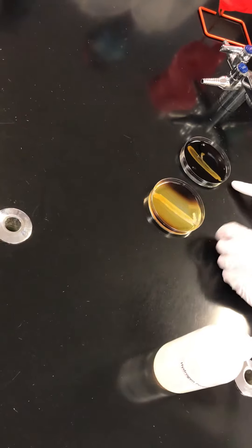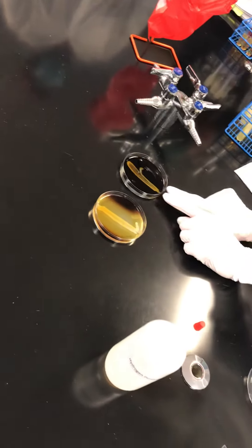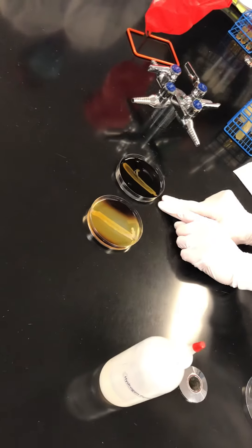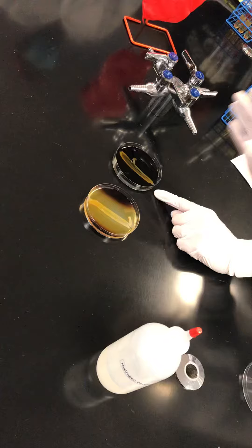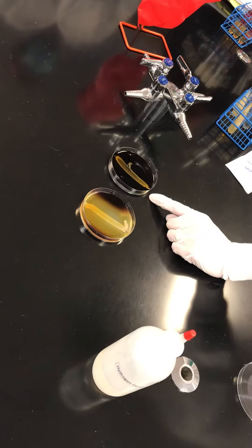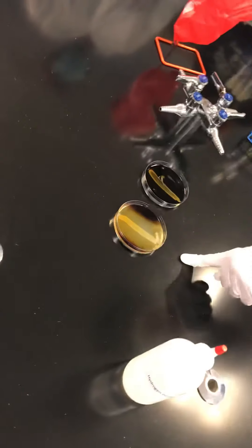This one, the starch is right up to the organism, so the organism did not secrete amylase. We can still detect the starch all the way up to the organism. So this would be negative, and this one would be positive.